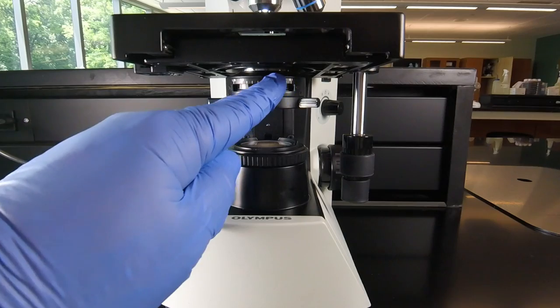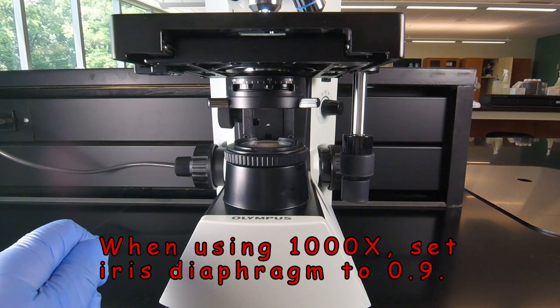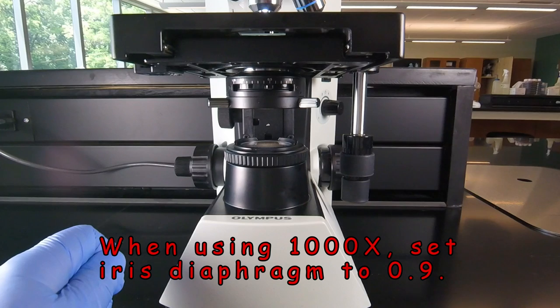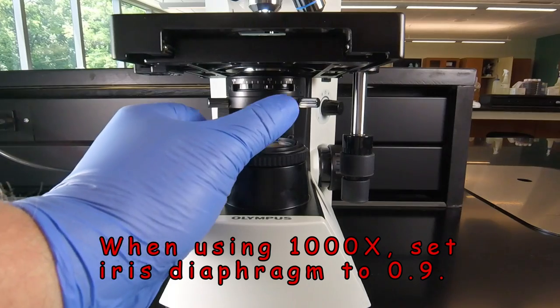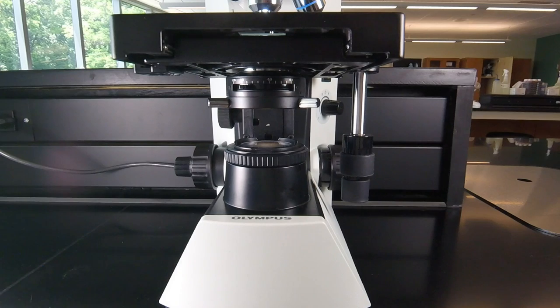So notice there's a lever that will slide left to right. And when we're using a thousand magnification or oil immersion microscopy, we want to make sure we have that set open enough that we have a pretty good chance we're going to see things. So basically we want to set the iris diaphragm lever to maybe 0.9, which is right there. That will give us enough light to see a specimen, but if it's a lighter specimen, there won't be so much light that it washes it out.